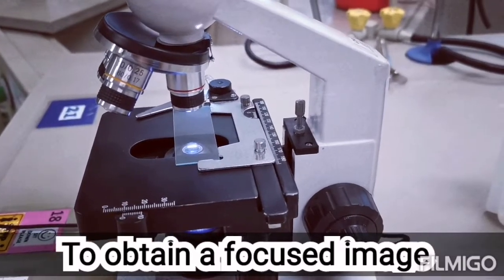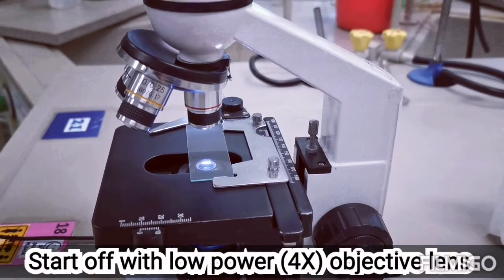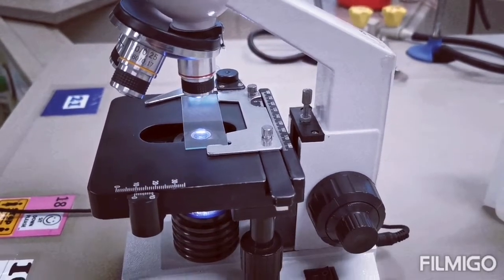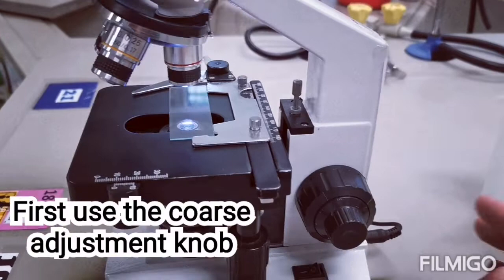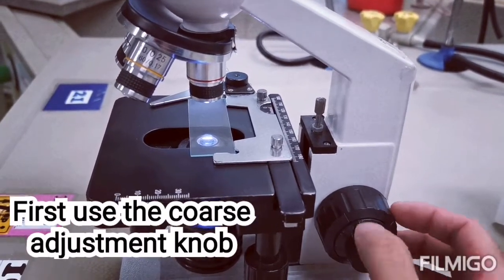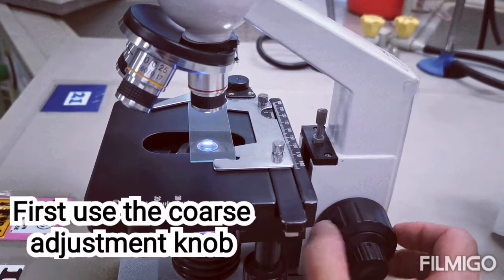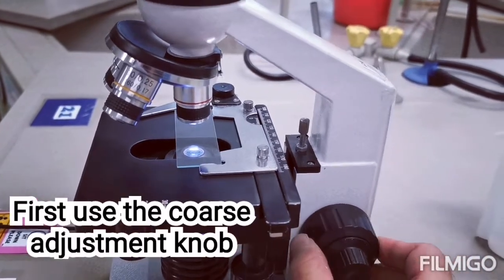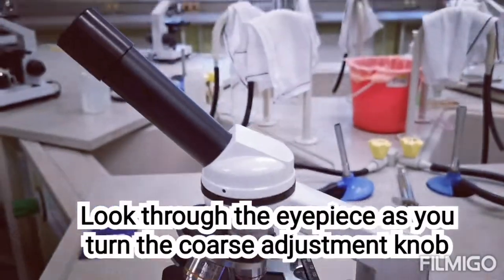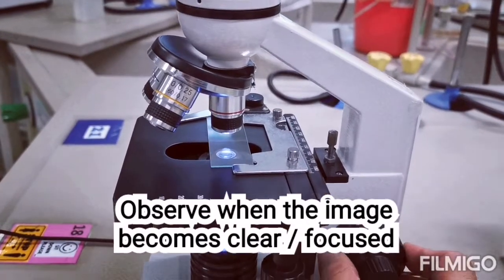When trying to obtain a focused image, we always start off with the low power objective lens, or the 4 times objective lens. Hence, we should first use the coarse adjustment knob in order to bring the stage closer to the 4 times objective lens in order to obtain a focused image. So turn the coarse adjustment knob as you look through the eyepiece, so that you can observe when the image becomes clear and focused.